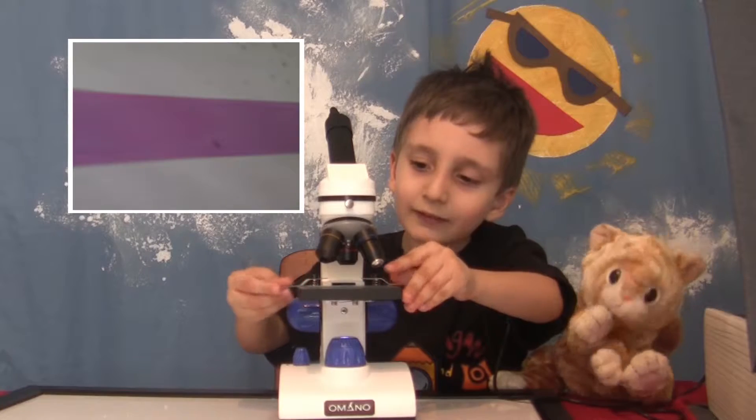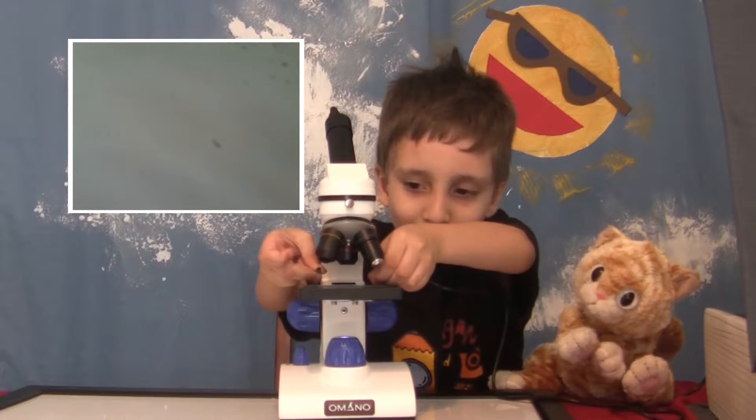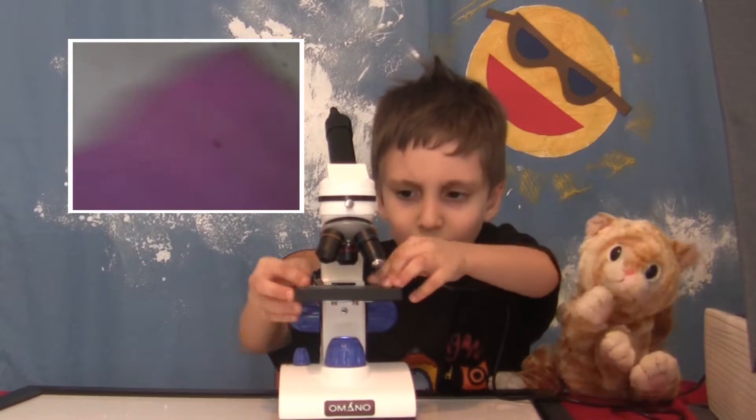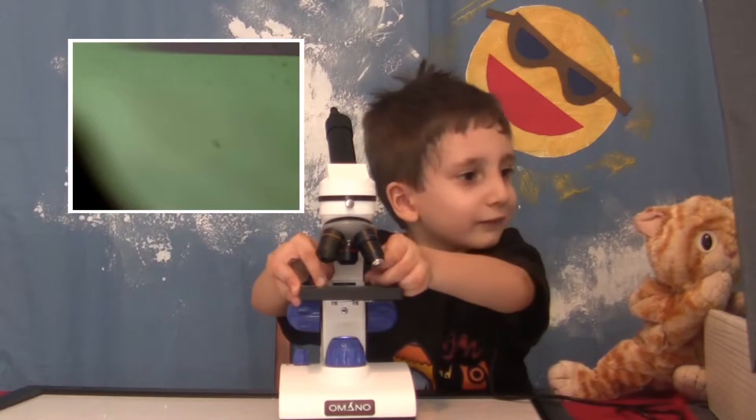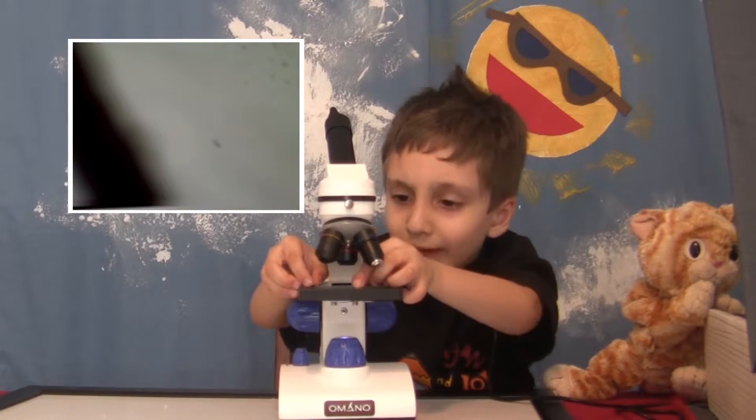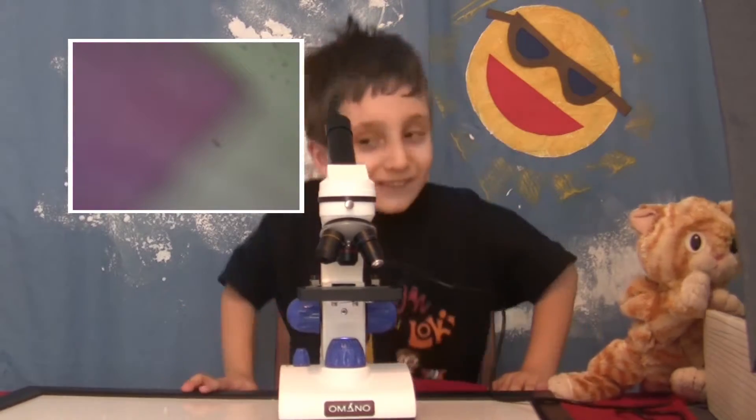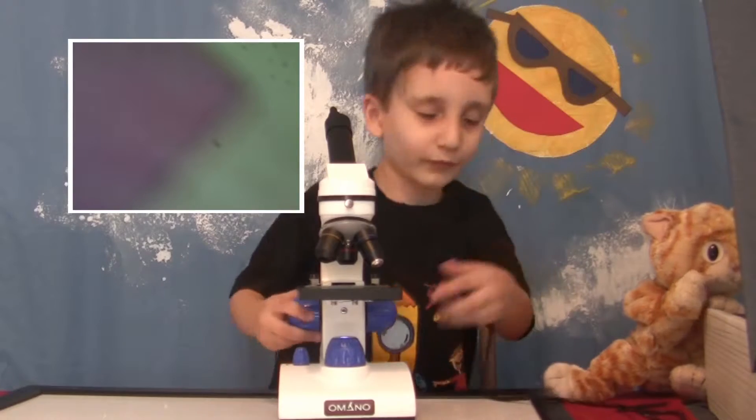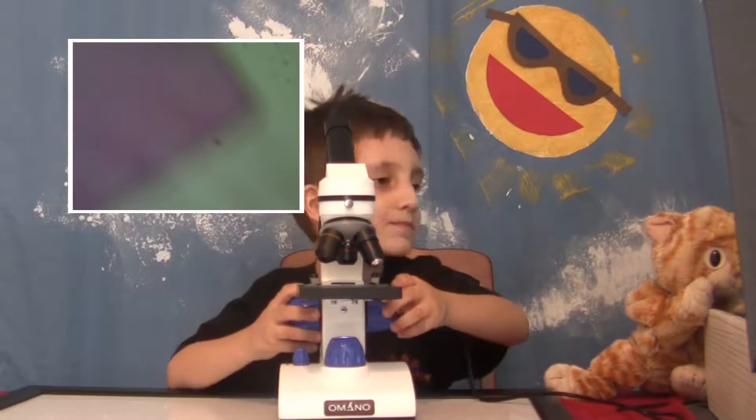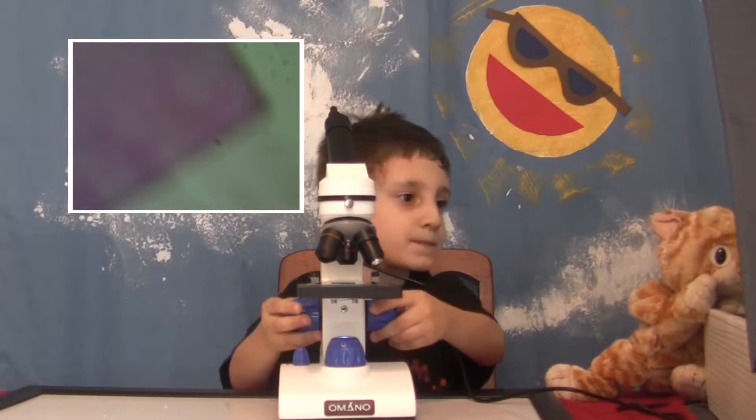Human blood. We're looking at human blood. Wait, wait, wait. Oh, there's something. There's something. Wait. And it moved. Will it be reddish? It is reddish. There it is! Oh, I see! Okay. Move it over a little, maybe. Okay. Start to focus. Let's see.